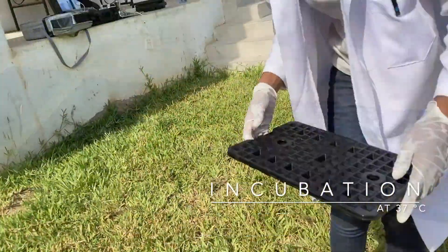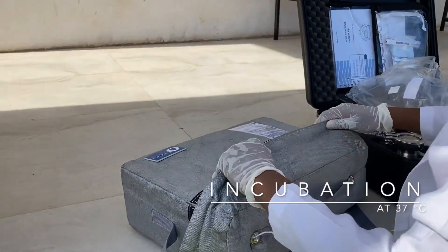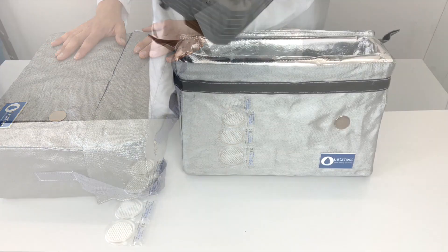After membrane filtration, incubate at 37 degrees for 24 hours. Use the electricity-free incubator with its very special black plates.